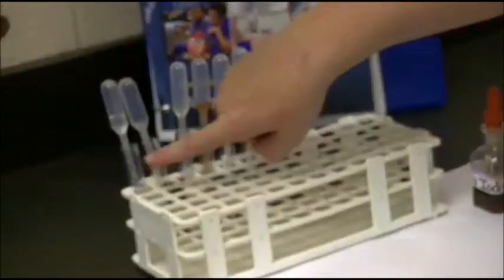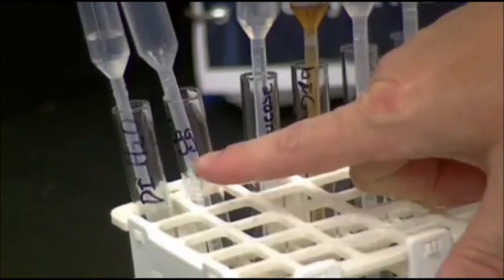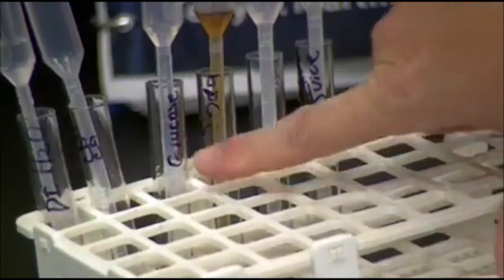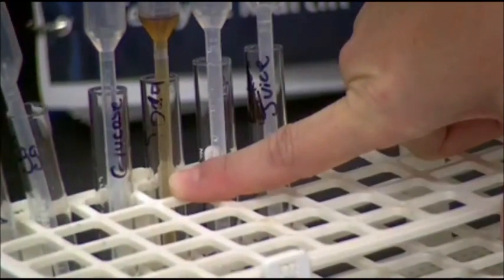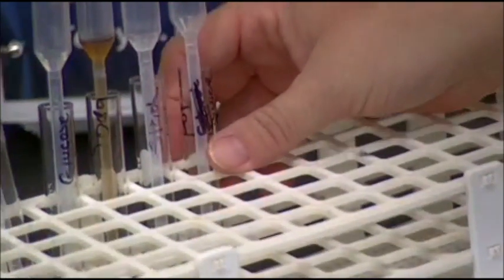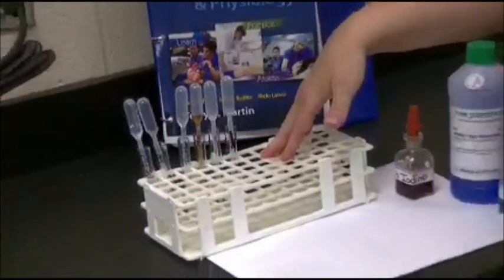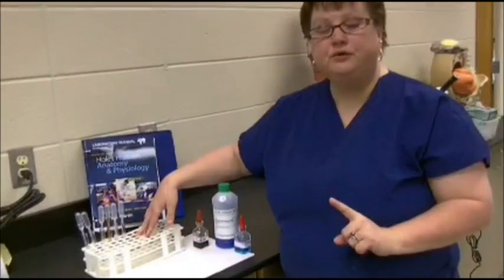We're going to use 6 different test solutions or specimens. That's going to be water, egg, a glucose solution, a soft drink, and I chose Diet Coke, yay. Then we have a starch solution, and then we have potato juice. So we're going to test these 6 specimens first of all for proteins.